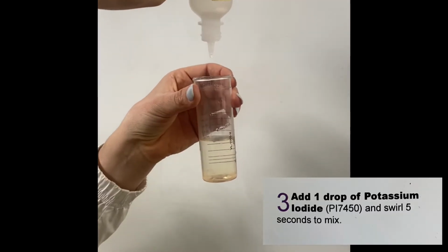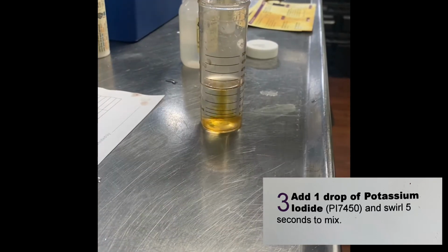Step 3, add 1 drop of potassium iodide and swirl for 5 seconds.